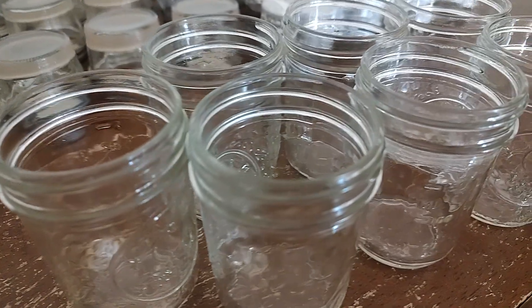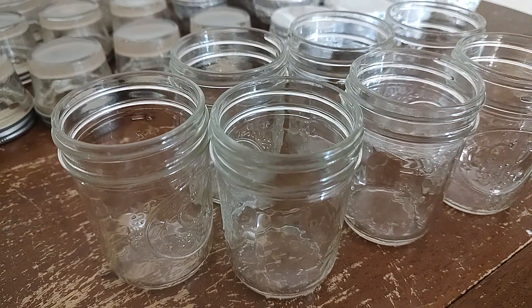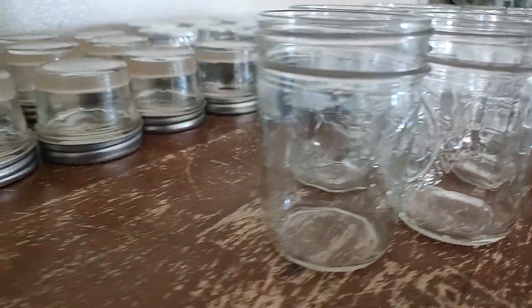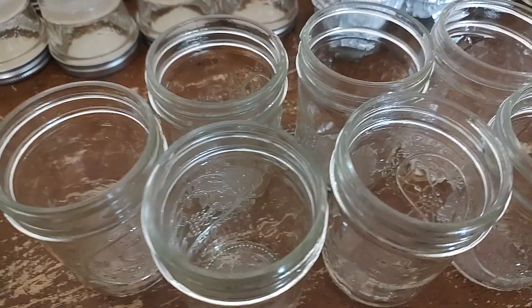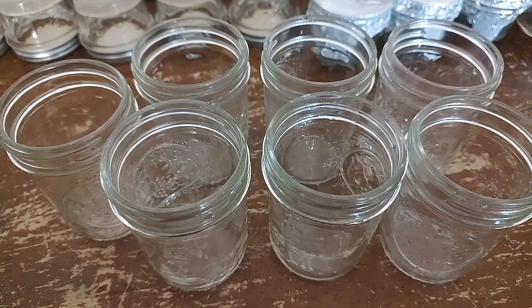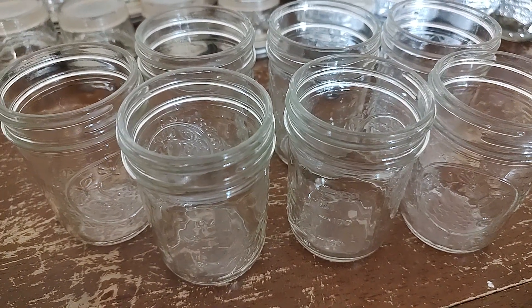For things that you're not very concerned about and you just want to do a quick pressure cooking, 20 minutes with your agar jars is perfect. That's what the husband did — he just popped the LC jars we use in with the agar jars for 20 minutes, and that's perfect. So again, if you need to do a deep cleaning pressure cook on something, go an hour and a half, an hour 45 minutes, even two hours. But if you're just doing a quick pressure cooking, you can do it for 20 to 30 minutes, just like you would for an agar dish or no-pour jar.